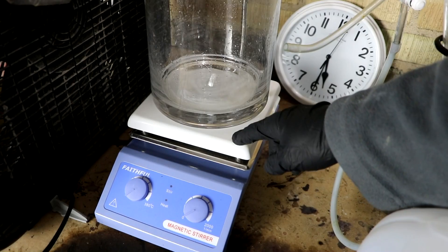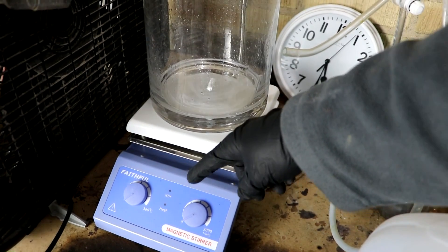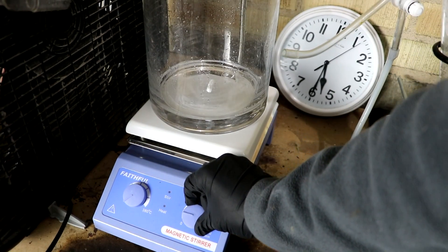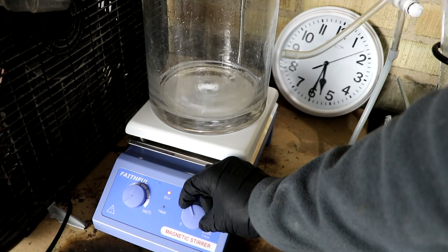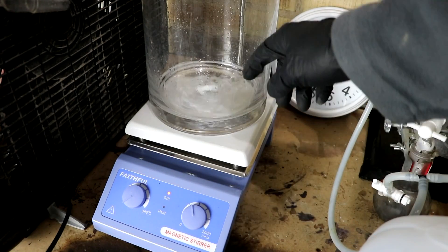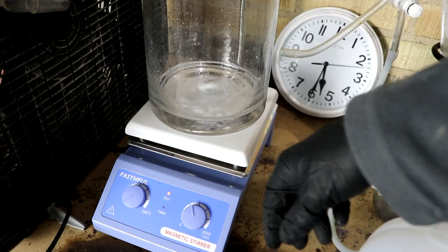Now I do have this whole thing on a hot plate. I'm not going to be heating it. I'm just using this so that I can stir this up and agitate the water so it'll react faster.